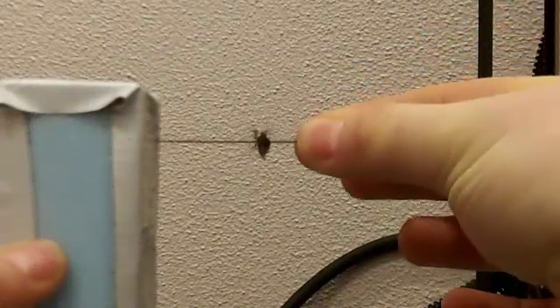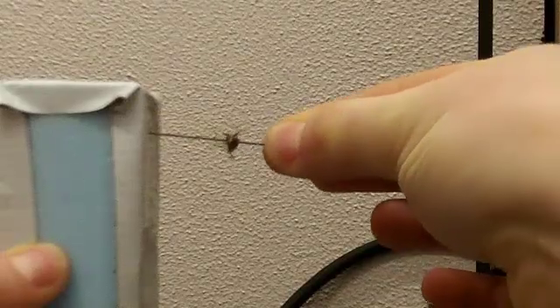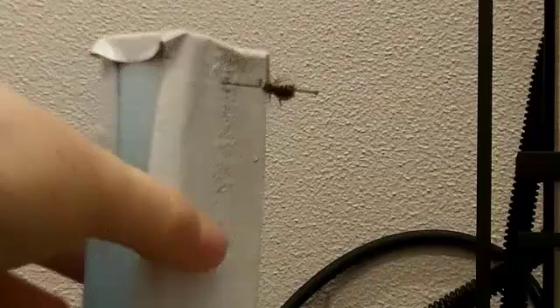For the lateral, we take our specimen and we stick the pin into the stand so that it is slanted slightly up. This way, the legs will be more in focus.